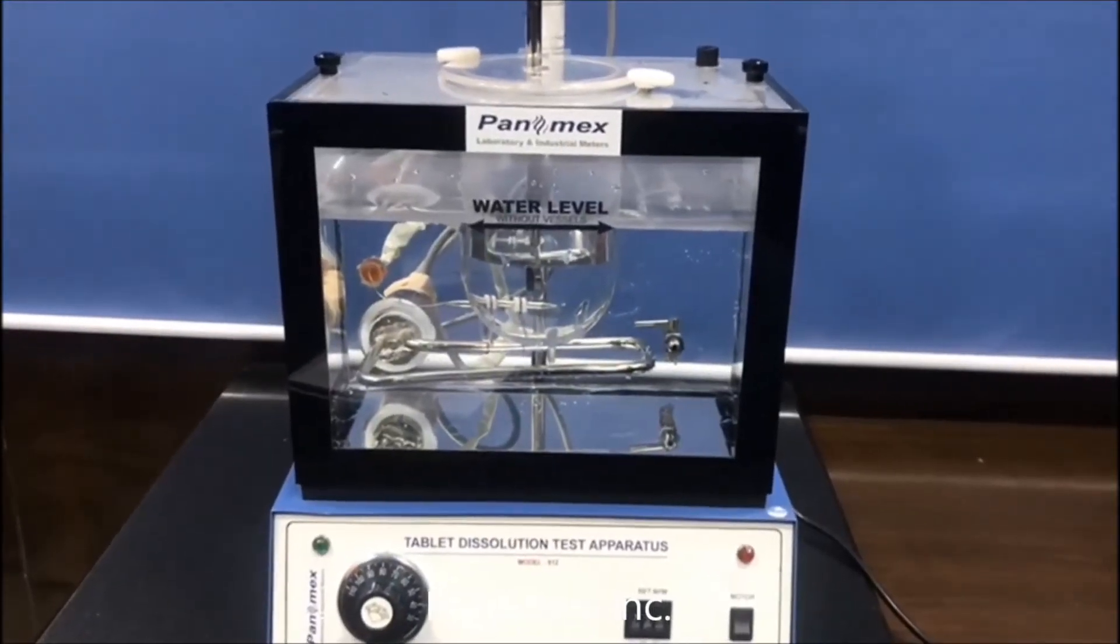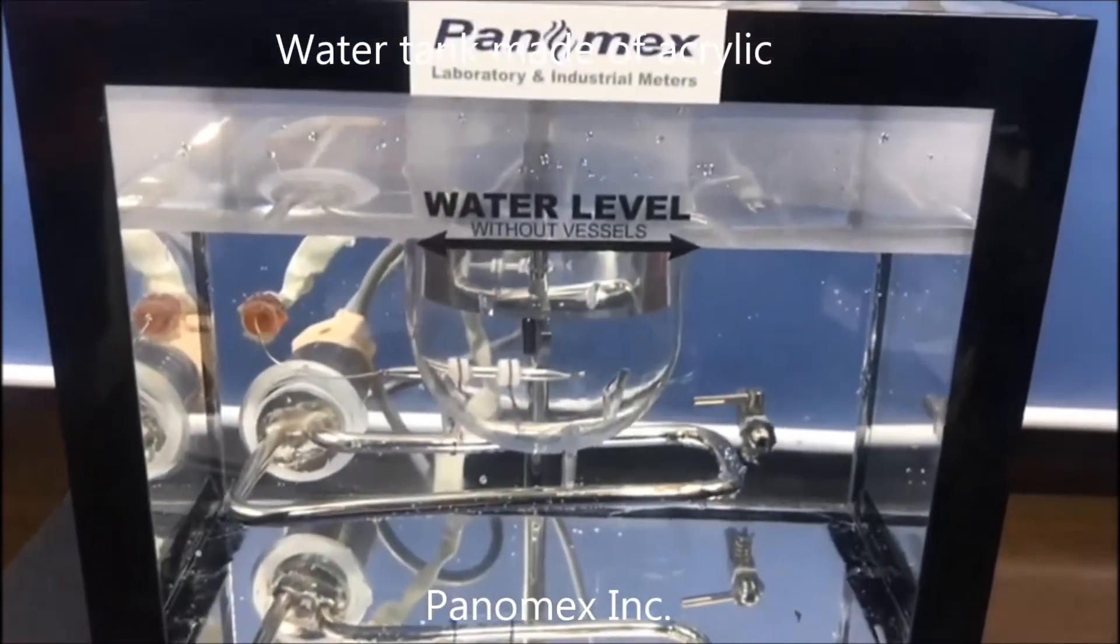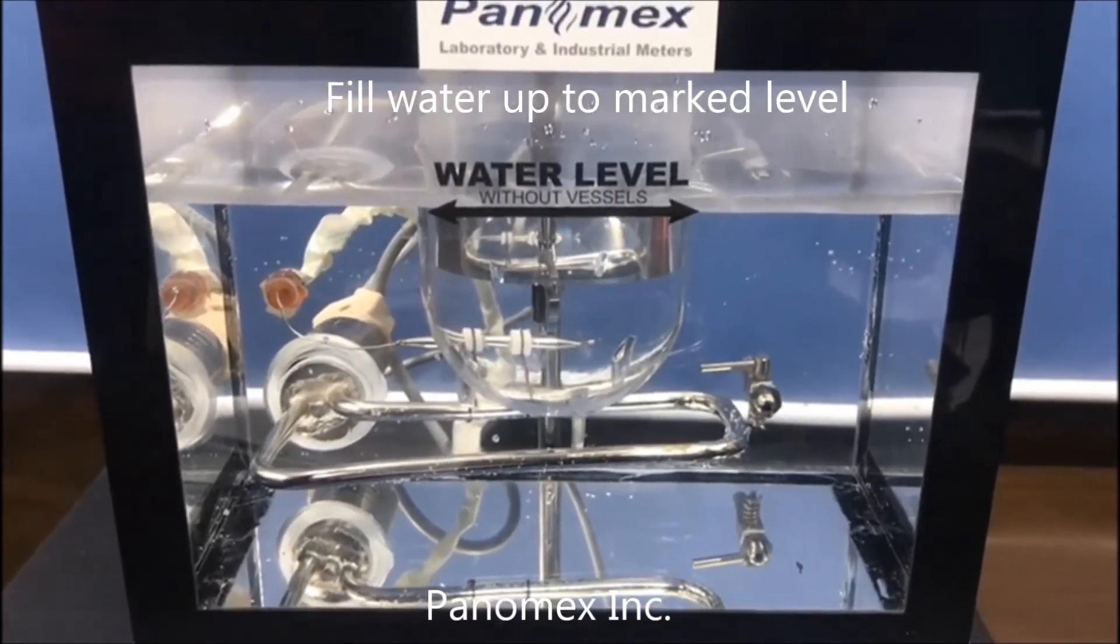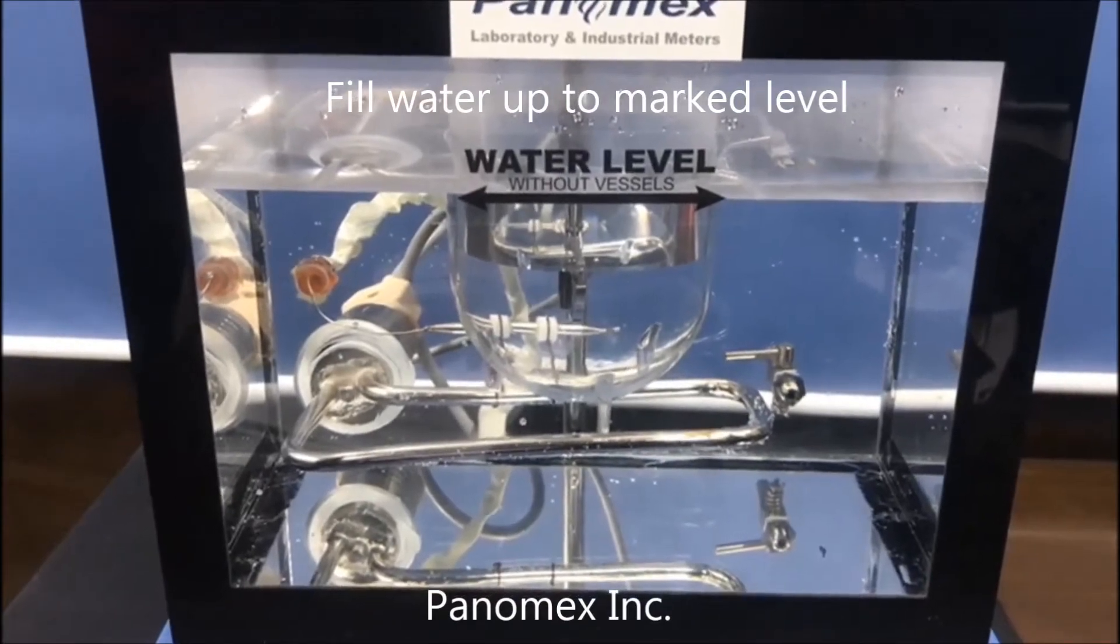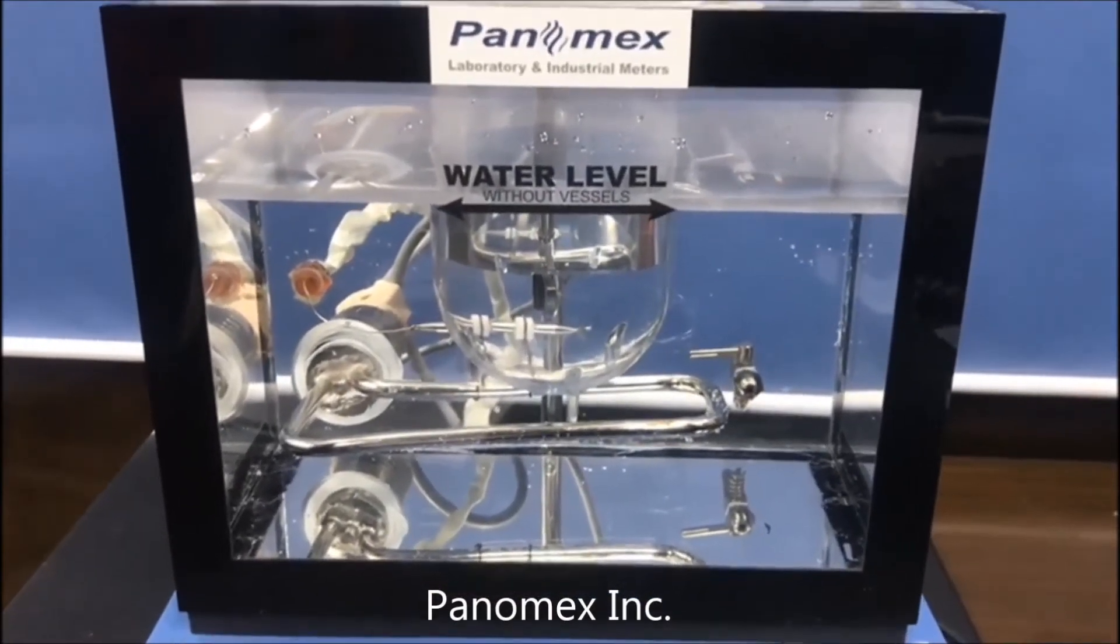This is the acrylic tank. As you can see, it is written here water level. Currently, water is present inside and the sensor is also there.